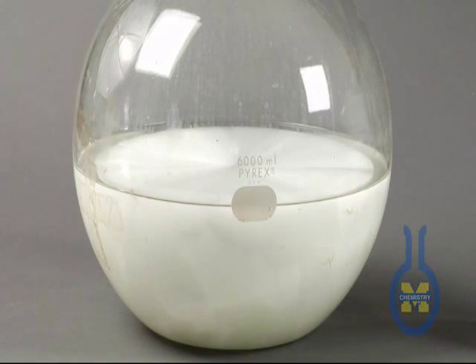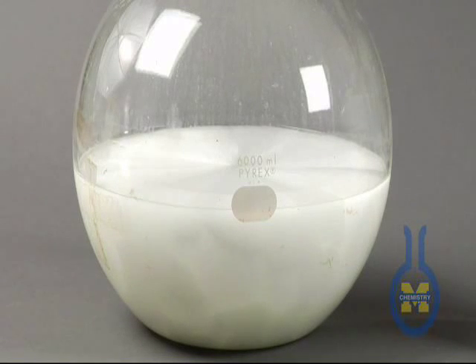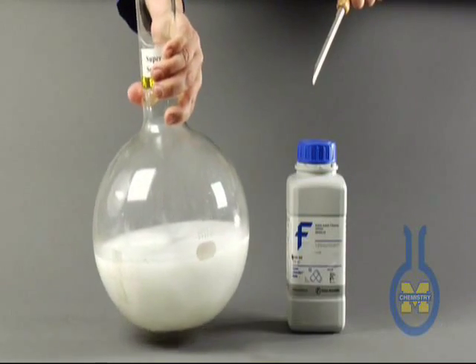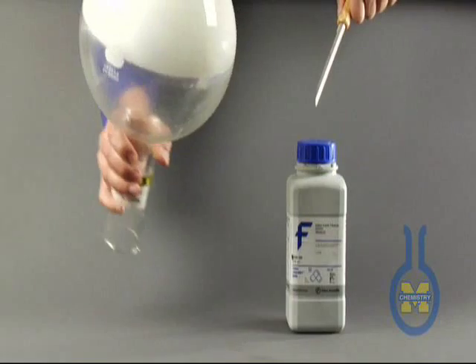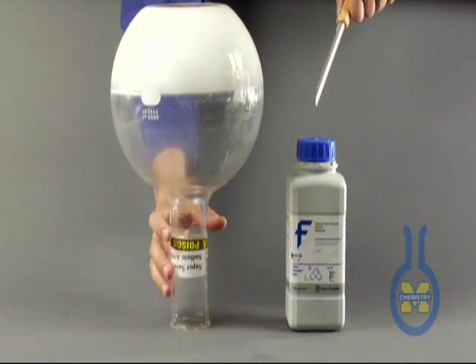If we were taking the temperature of this, there would be heat released. It takes heat to dissolve these salts and when they come out of solution, they release that energy.